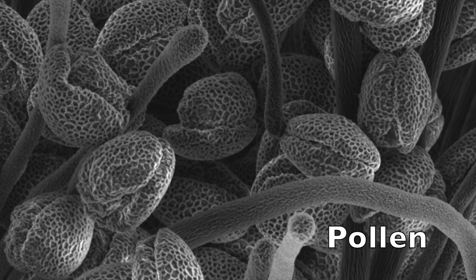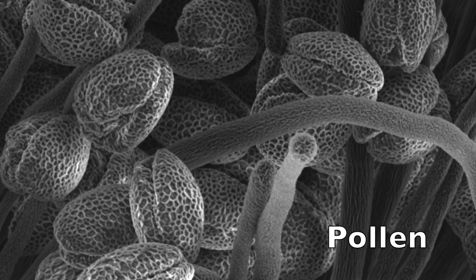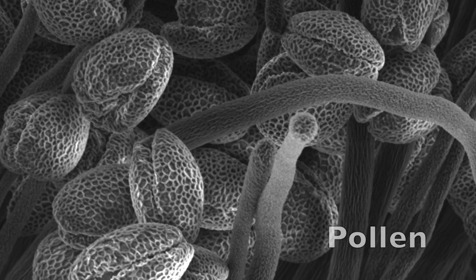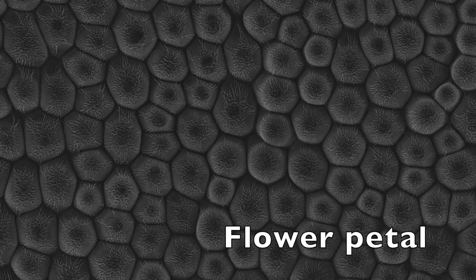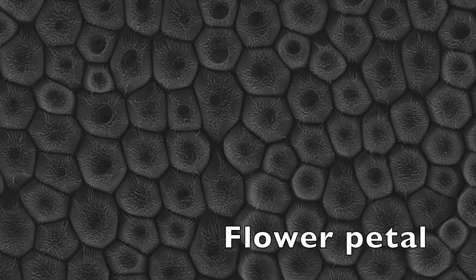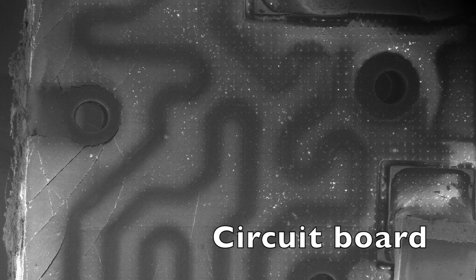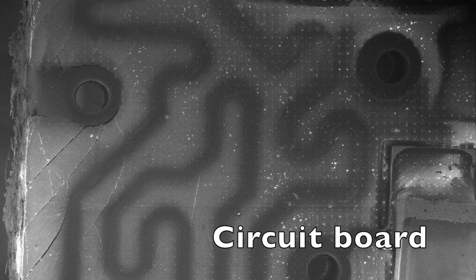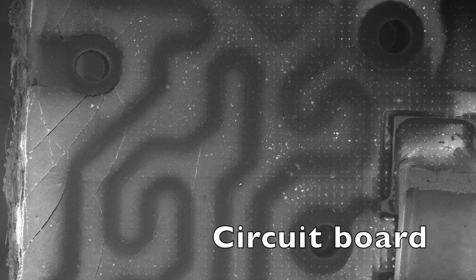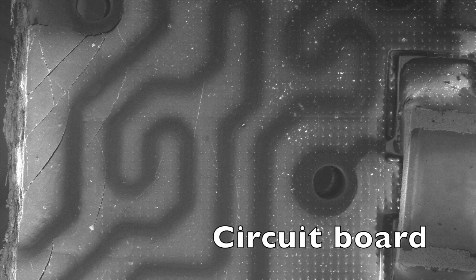Some SEMs can get up to a million times magnification. This one will go into the 100,000-ish range. We can image things that are maybe tens of nanometers in size.